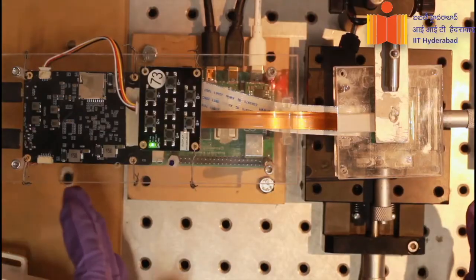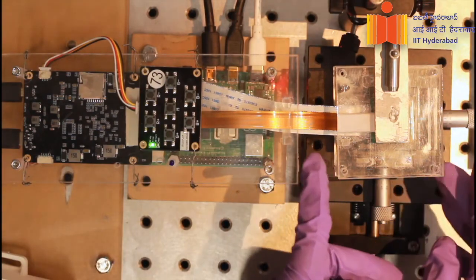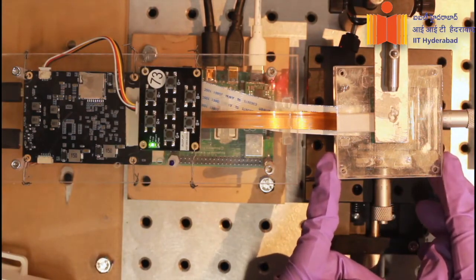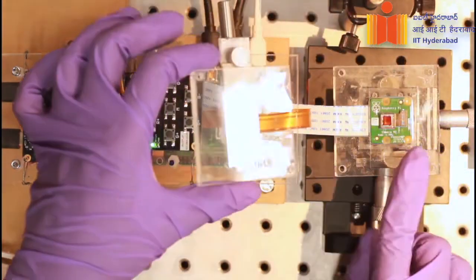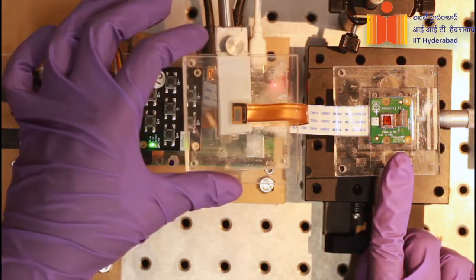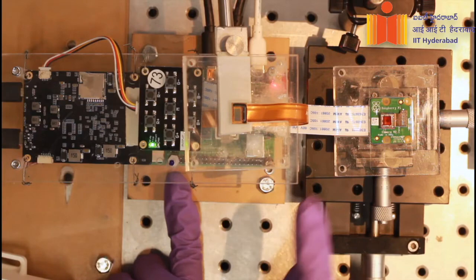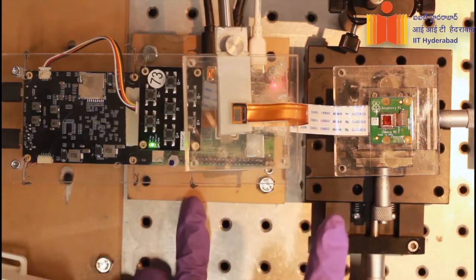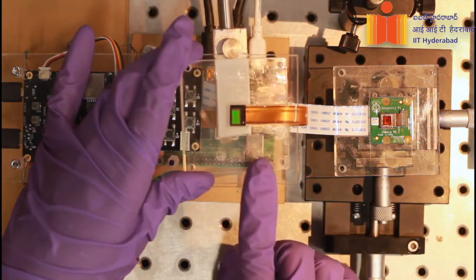In our lab, we have developed an on-chip lensless microscope called Muscope, which we will be showing in this video. This is the top view of our homemade imaging setup. This is called Muscope. It comprises two electronic chips. The first one is a camera sensor chip. It is connected to the single board computer through this white flexible cable. The other chip is a micro LED display chip, which is the key component of Muscope.